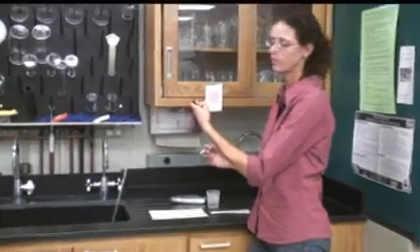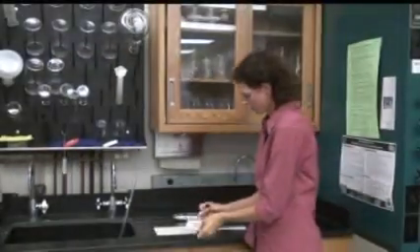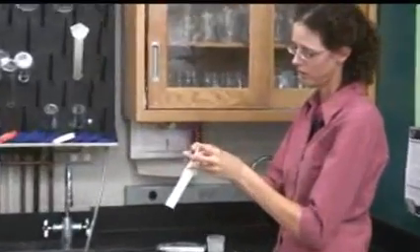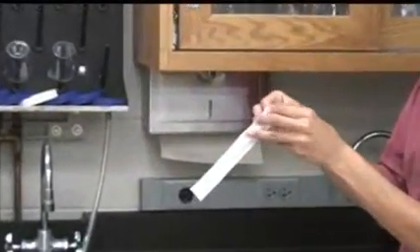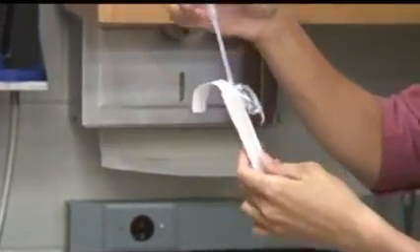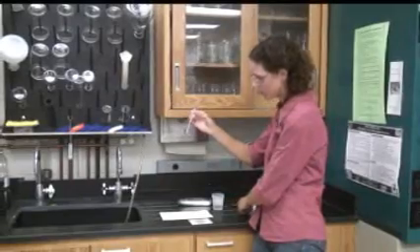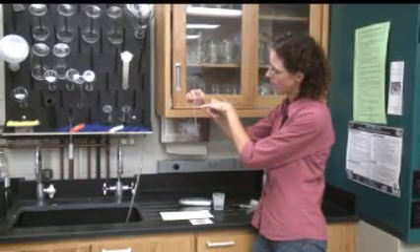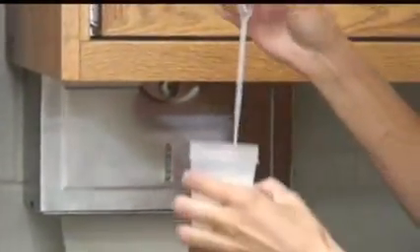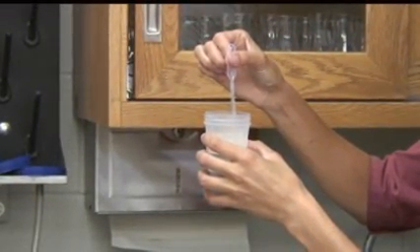So you have your labeled sample. Then, opening from the top of the pipette, peel it down like a band-aid. Remove it from the wrapper, being careful not to touch the tip on any other surface or with your fingers to prevent possible contamination. The one milliliter mark is right below the bulb of the pipette. So you pull your sample and pipette up one milliliter of water.